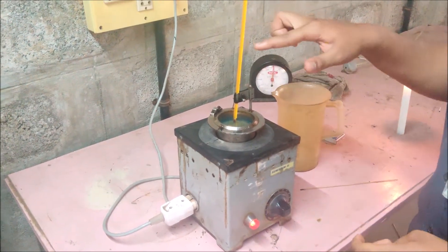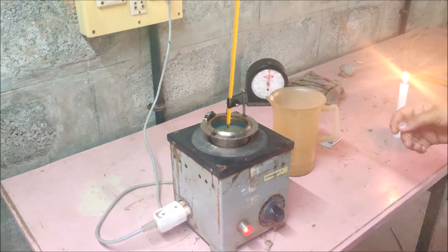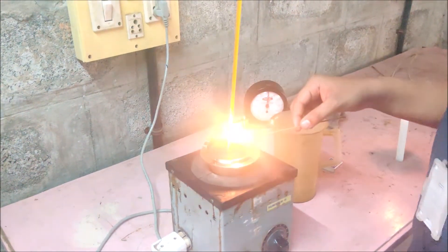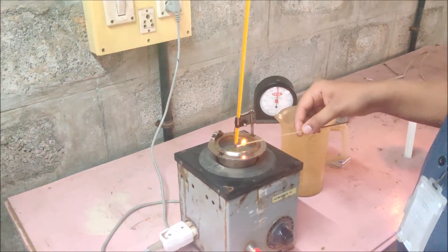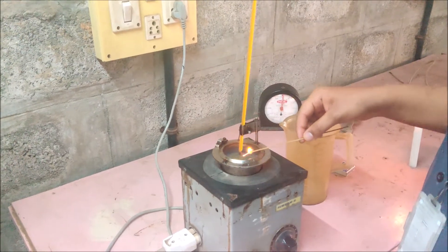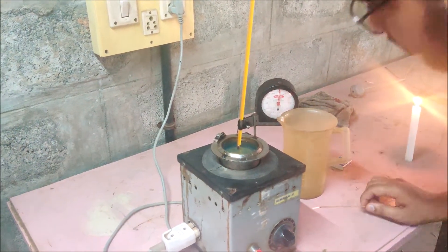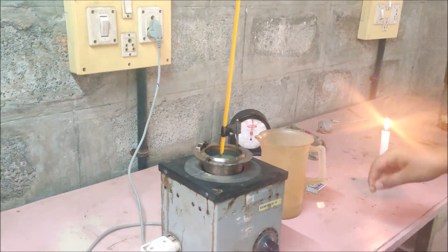As the temperature rises, the thermometer indicates it. So let's take a small stick and light up the fire. We should take it around — make sure you don't touch the fuel. Just take it around like this. As the temperature rises, there will be a flash. Right now the temperature is around 30 degrees, so there is no flash.